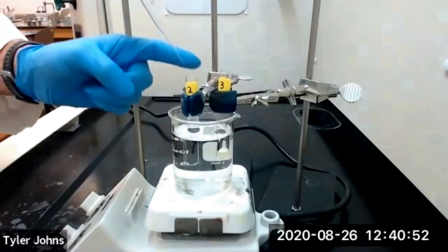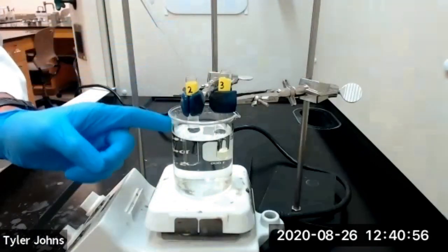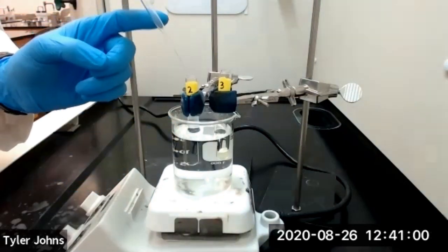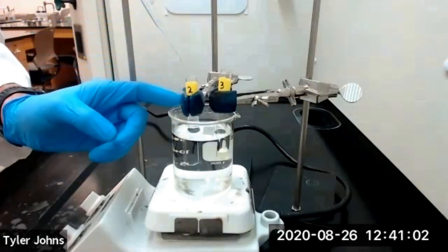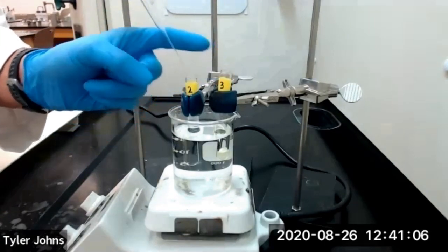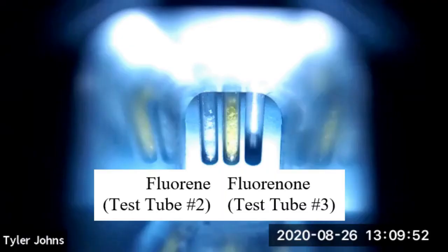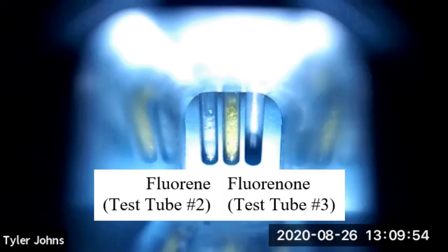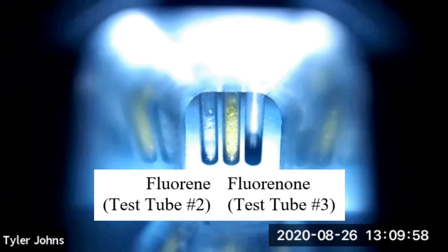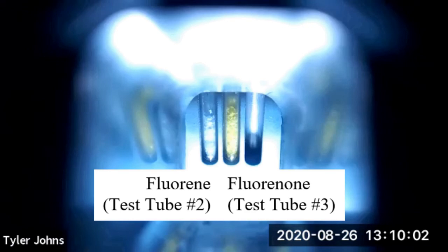We'll evaporate the solvent from test tubes number two and three. We'll now determine the melting point of the fluorene and fluorenone that we separated using column chromatography.